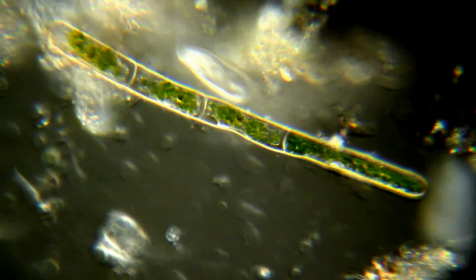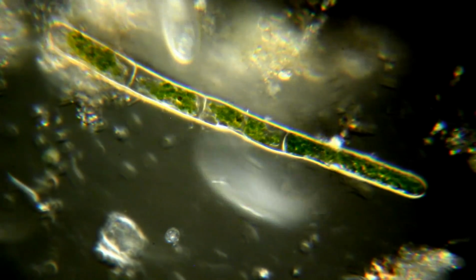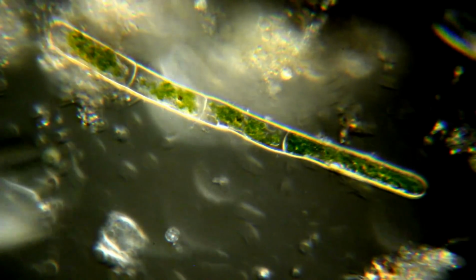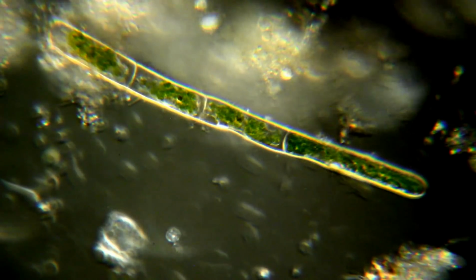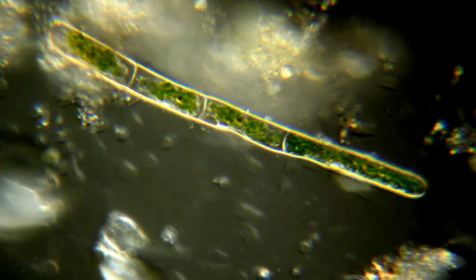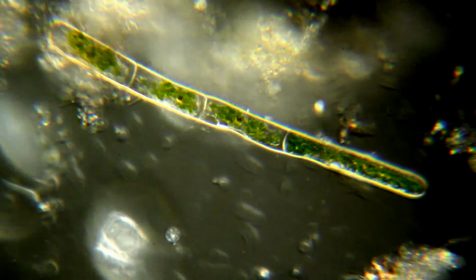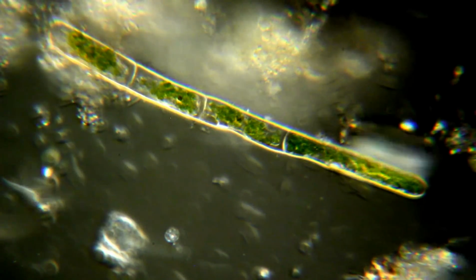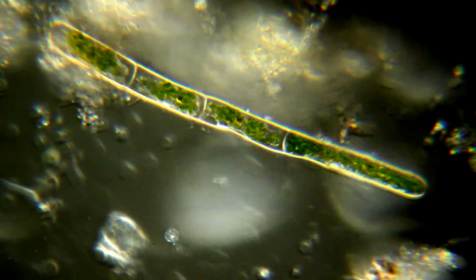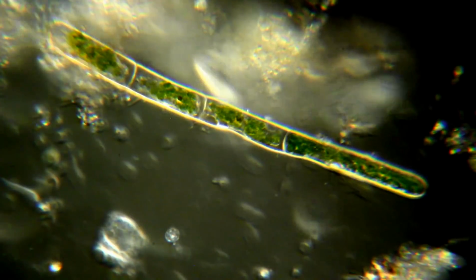Okay, this is just a test video. I have my new Zeiss, actually it's an old used one, turret condenser set to dark field, but the condenser sits on top of my Amscope 490B condenser holder. And there's some stuff on the bottom of the stage that interferes with it being able to come up all the way to the slide.